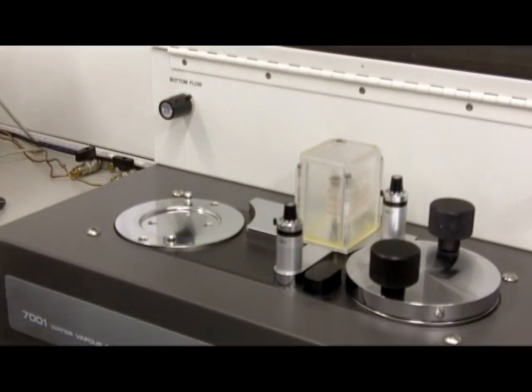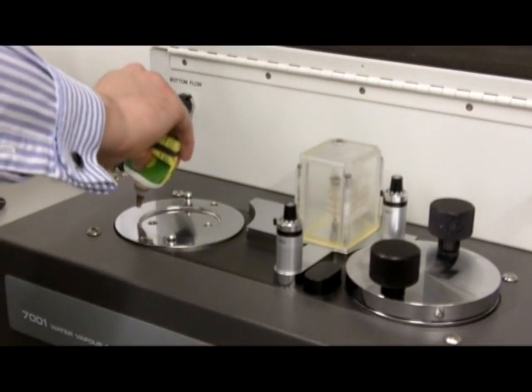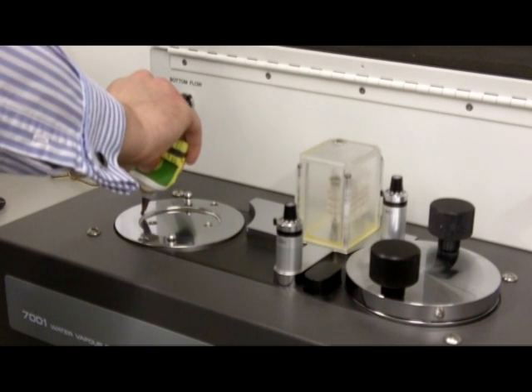Now that we have the film sample, we next remove the chamber lid, then apply grease for an airtight seal.